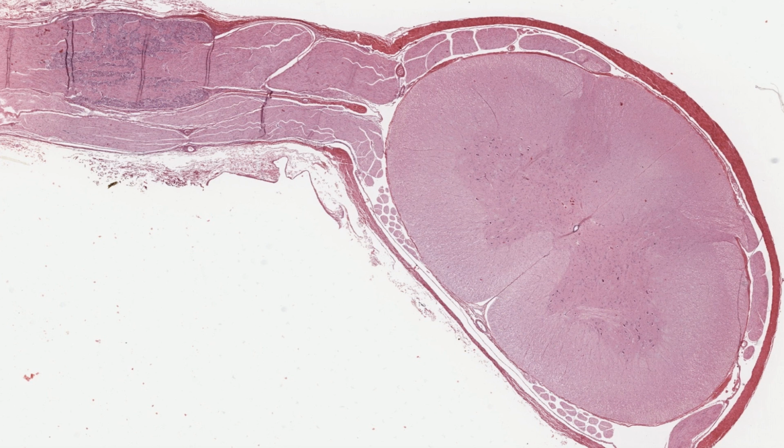This extension is where the cutting blade has sectioned the dorsal and ventral nerve roots that emerge from the spinal cord and will unite to form a spinal or peripheral nerve. The dorsal root projects out as far as the dorsal root ganglion, which is this region here. Then the roots unite and form a spinal nerve.